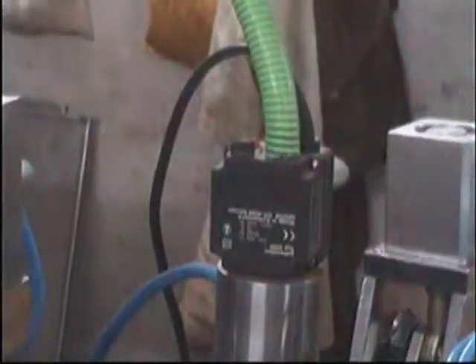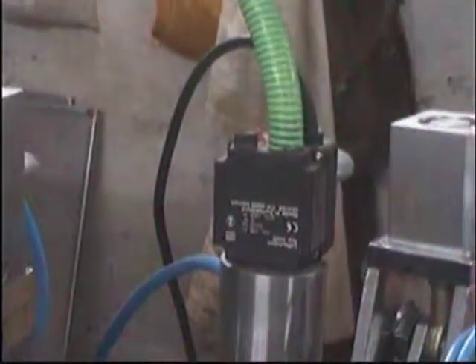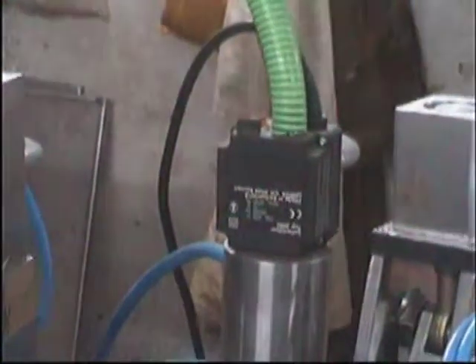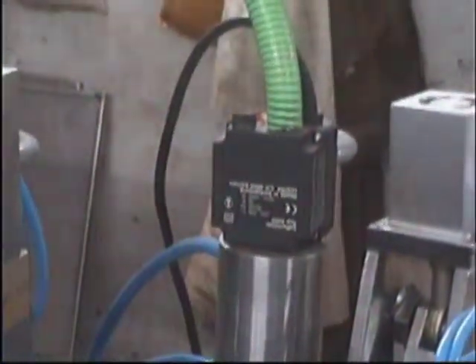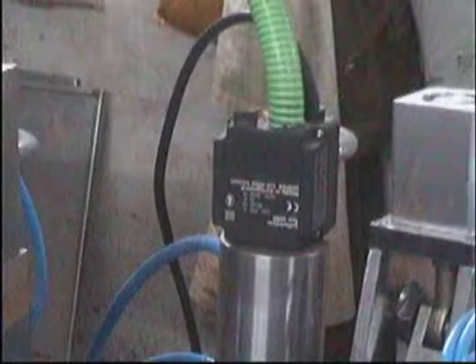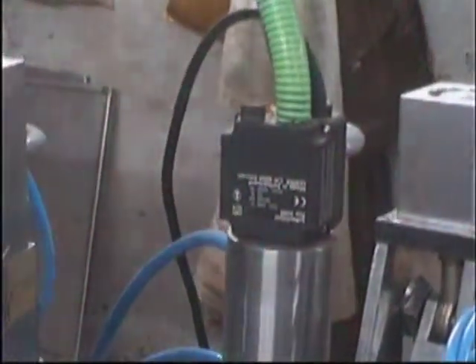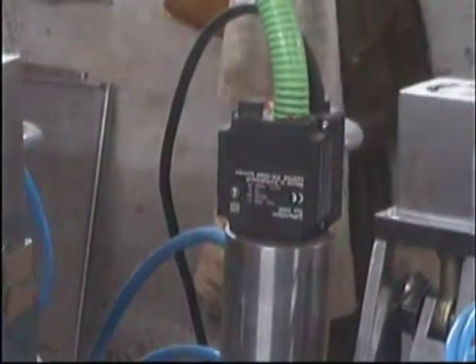You are seeing the hot air tool, which is supplied by electric current. The green hose is for the blower. The blower should always be turned on before you start the heater, and after you stop the heater the blower should be kept on for 5 to 10 minutes.